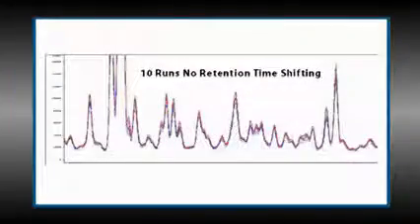And here's an example of an issue that could come from a wide range of problems. Here's what we're talking about with retention time shifts. Now, what could cause this? Well, if your issue has occurred after installing a new column, then most likely a shift in retention time is due to dimensional differences in the old and new columns. The previous column was likely trimmed during inlet maintenance, and so the new column is likely longer than the old one. Also, there's column-to-column variation due to dimensional tolerances.